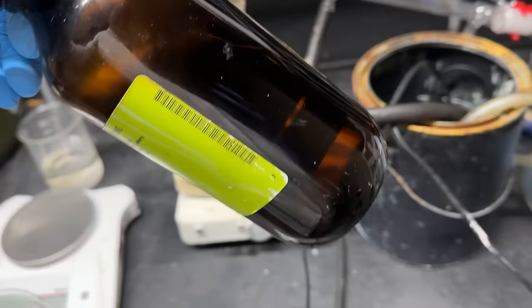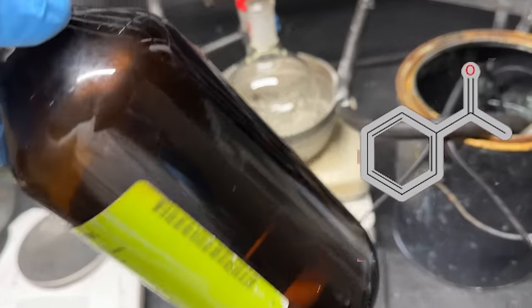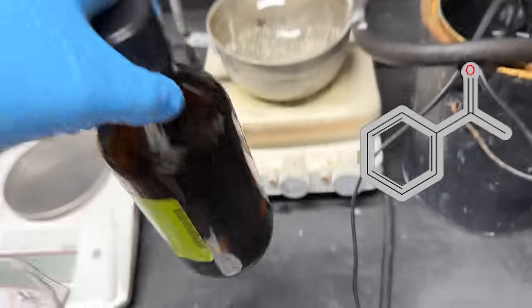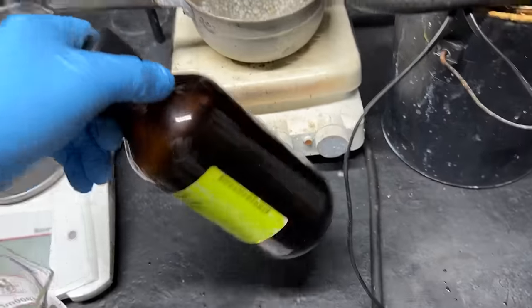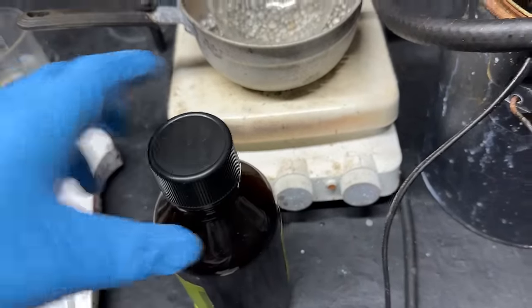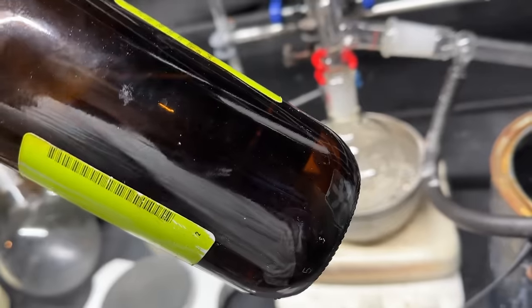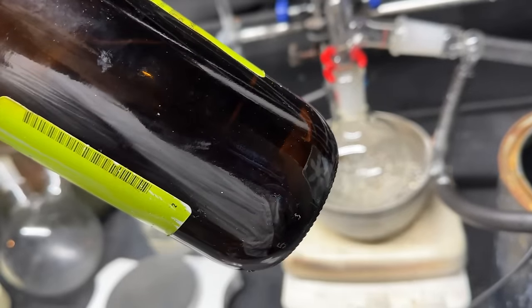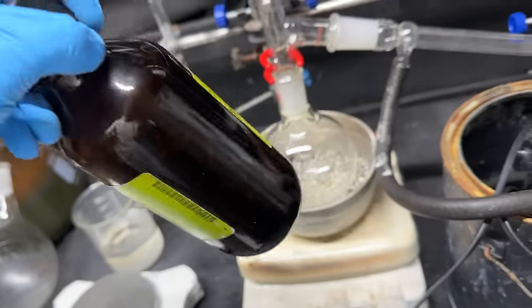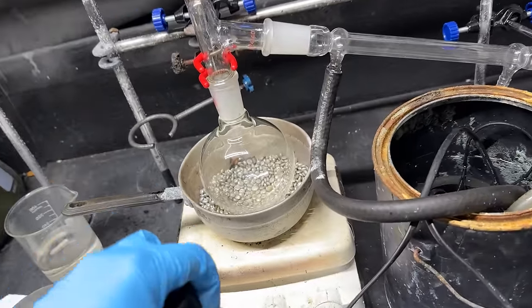To start the histamine synthesis, we're going to need acetophenone — it's going to be our high boiling point ketone catalyst. If you've seen my serotonin videos, you know exactly what we're going to be doing here. But first I'm going to give this a redistillation because it's still full of indoles which makes it smell awful, and I want some nice pure acetophenone, so we're going to do a distillation.